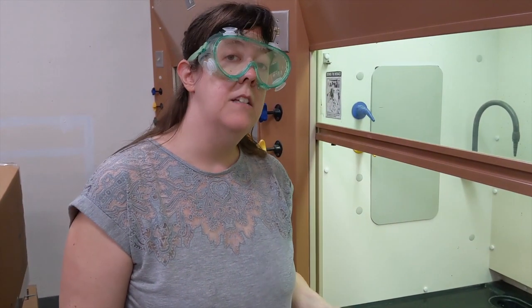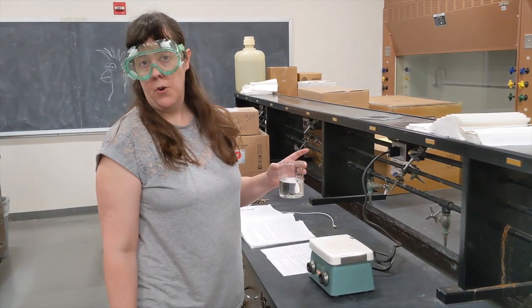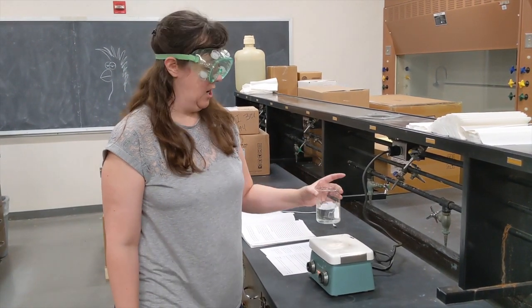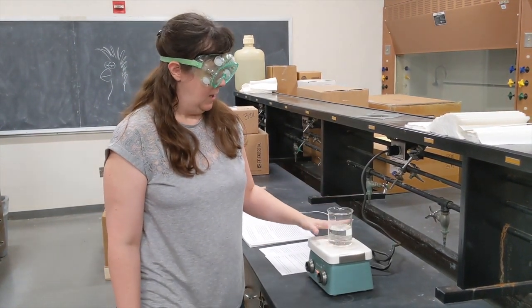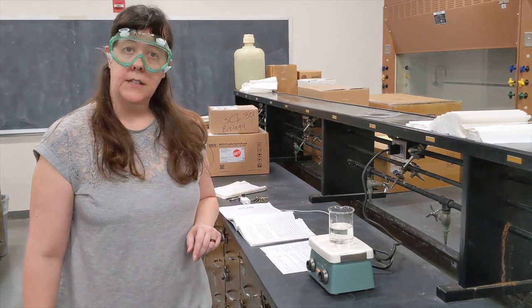The next thing I'm going to need to do is create a hot water bath, because this reaction needs some heat to happen at a reasonable rate. Your lab manual tells you to use a Bunsen burner to heat the water, but since it's just me in here, I'm going to go ahead and use the hot plate. I'm going to check. Yep, that is getting warm. So we're going to leave that until it comes to a boil.